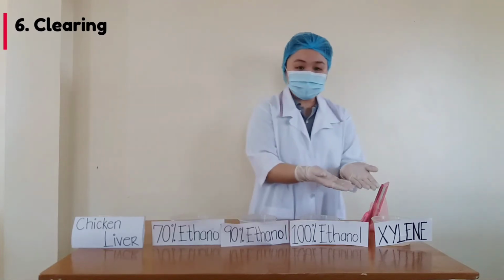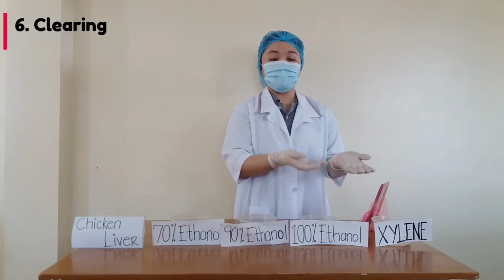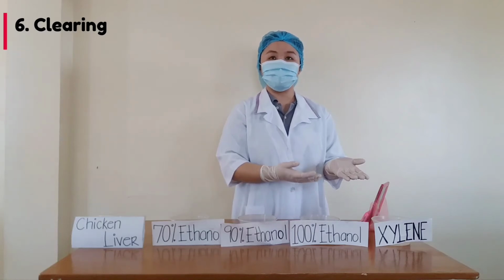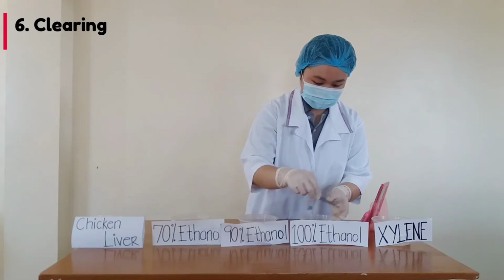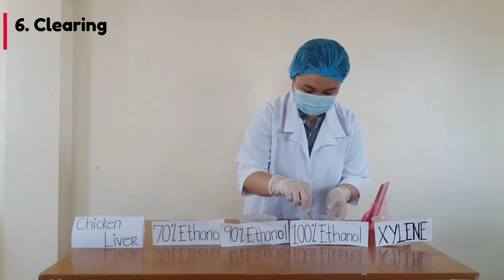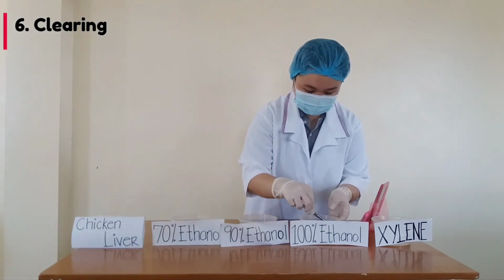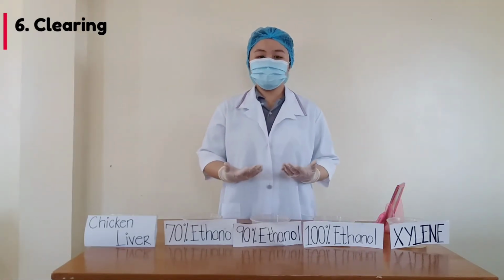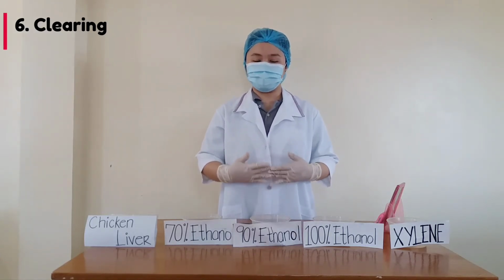So, we have our xylene, which is the most common clearing agent used in the laboratory. If xylene is not available, then we can use toluene or coconut oil, which we can find in our kitchen. After the clearing process, the specimen is now ready for the embedding, which makes use of the melted paraffin.